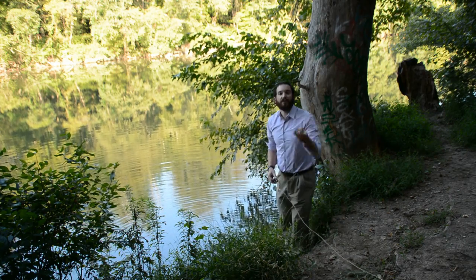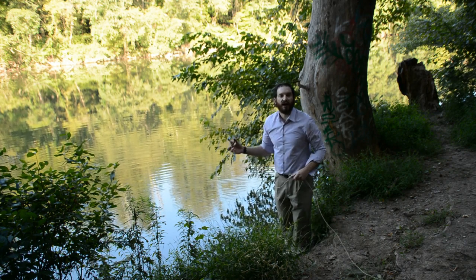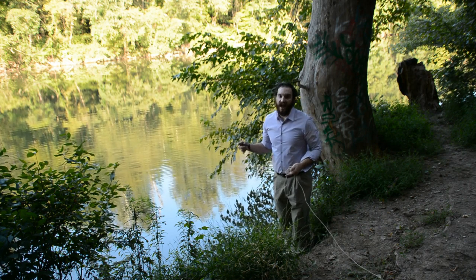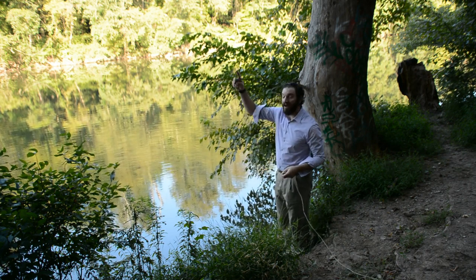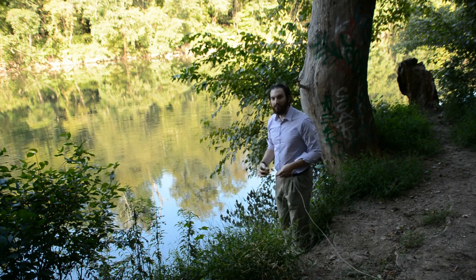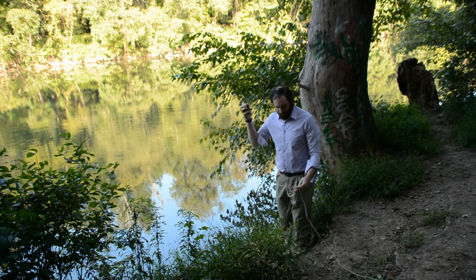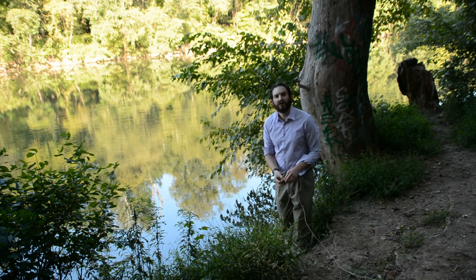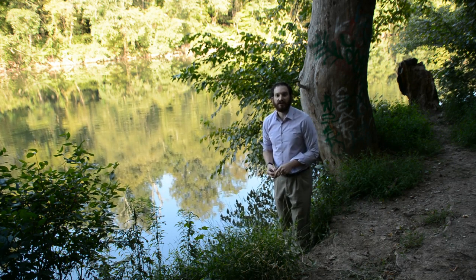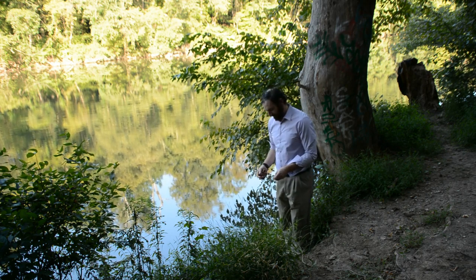Now this apparatus has an extra little weight to it. I know it looks like we're in the shade right here, which is going to be really counterproductive to the experiment. The thing is, this area will get a lot of the afternoon sun. So as the sun passes over, this area will get a lot of sun. And what I'm going to do is throw this weight to pull the apparatus out. By putting the weight and the anchor further out, it will help to pull the apparatus further out. And then I'll use this last leader line to tie it off and anchor it so that I can come back tomorrow and retrieve it.